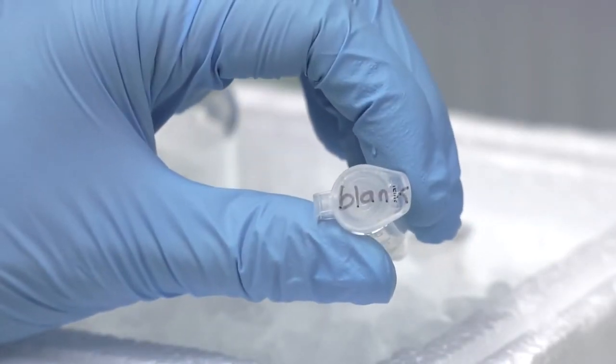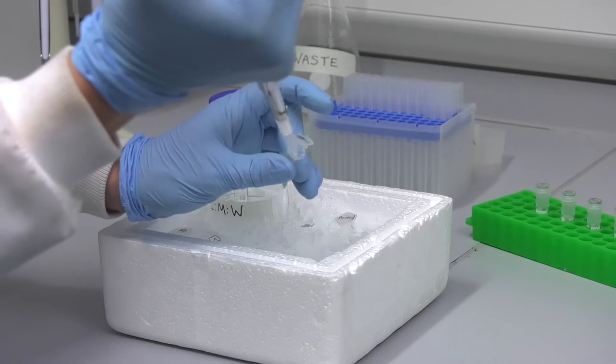Step 4. Prepare a blank sample of 200 microliters extraction solvent and process it alongside your other samples.